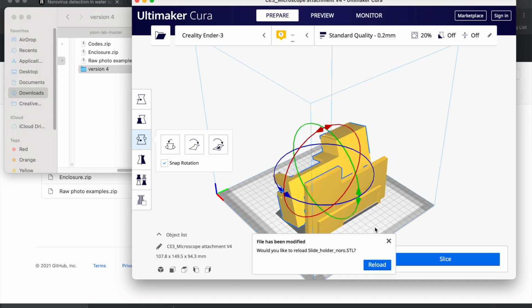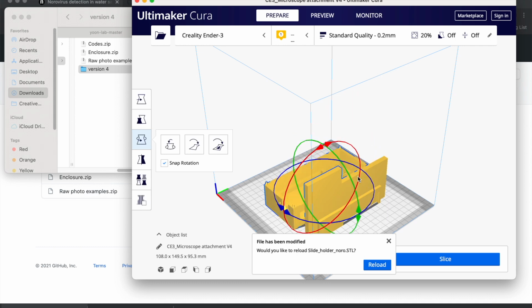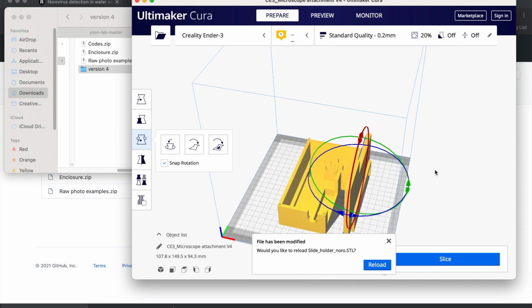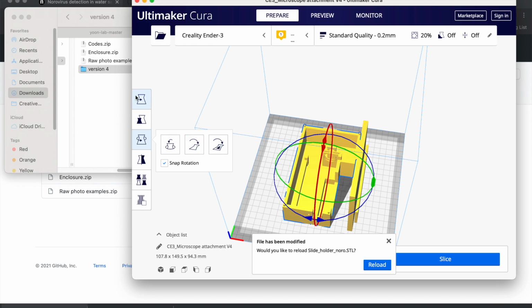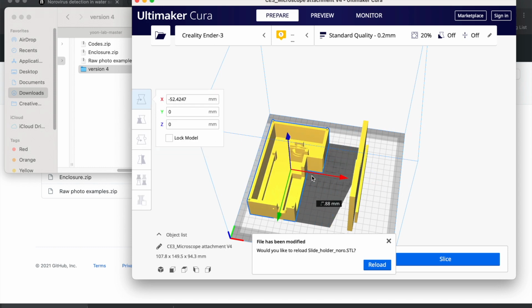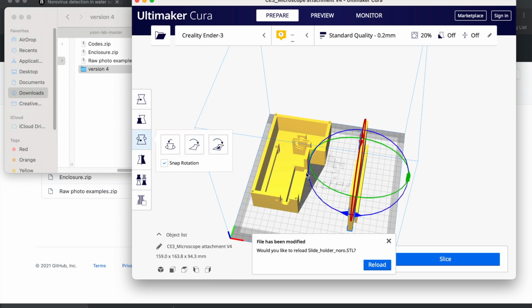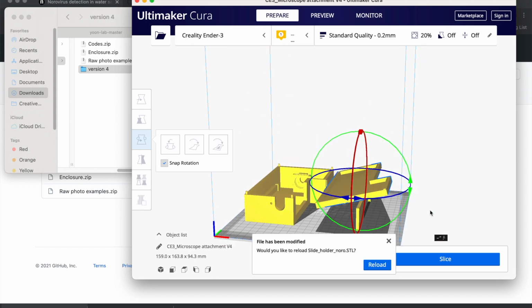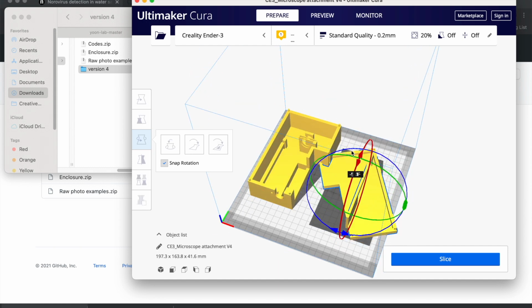So what I'm doing is I'm rotating the parts so that they are optimal for 3D printing. If I had printed this piece upside down, then there would have had to be so many supports, it would have taken forever and been a little messy. So this is just the name of the game. You don't have to do anything specific. Just whatever works for you. Okay, let's give this one a twist around.